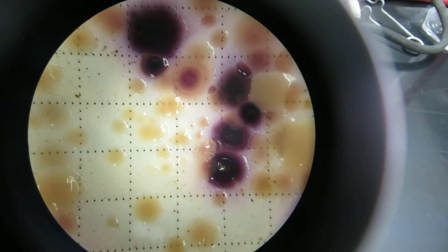This is an mTEC plate. This is used to quantify the amount of E. coli in a water sample. This sample is from the Santa Monica stormwater runoff.